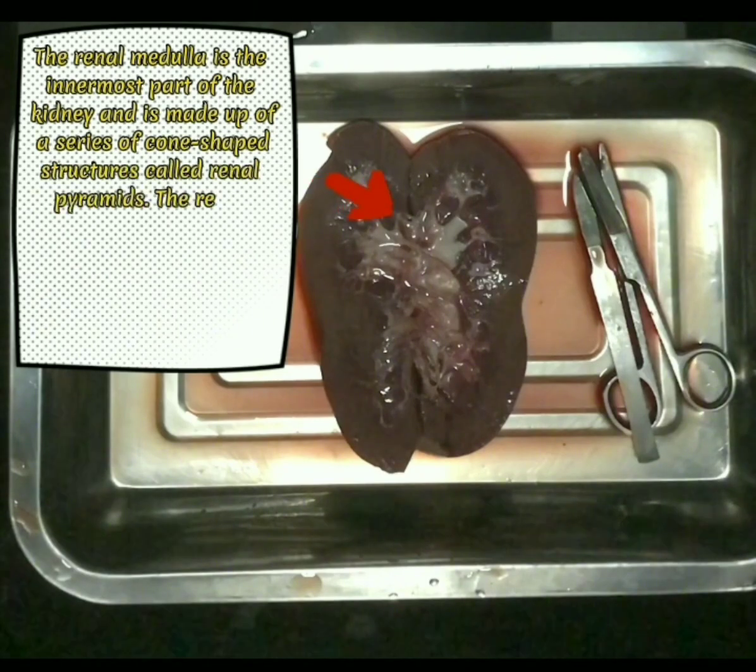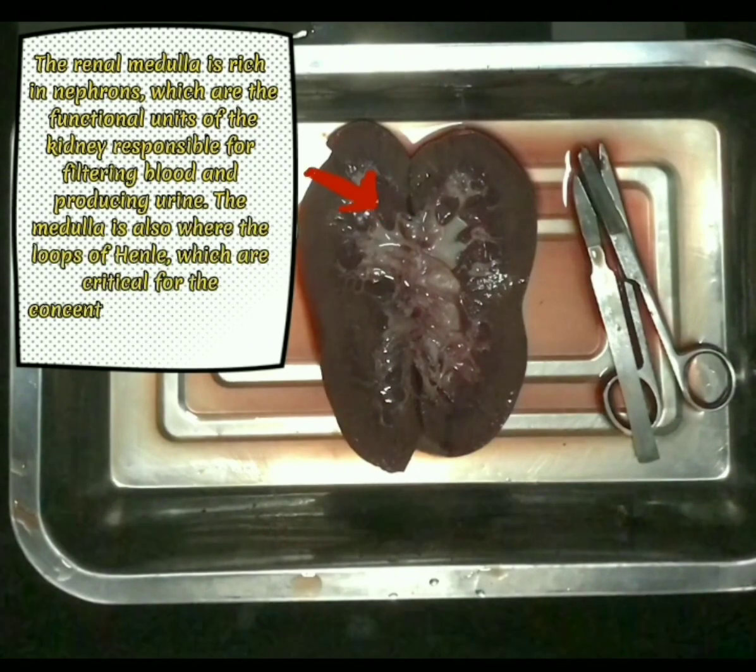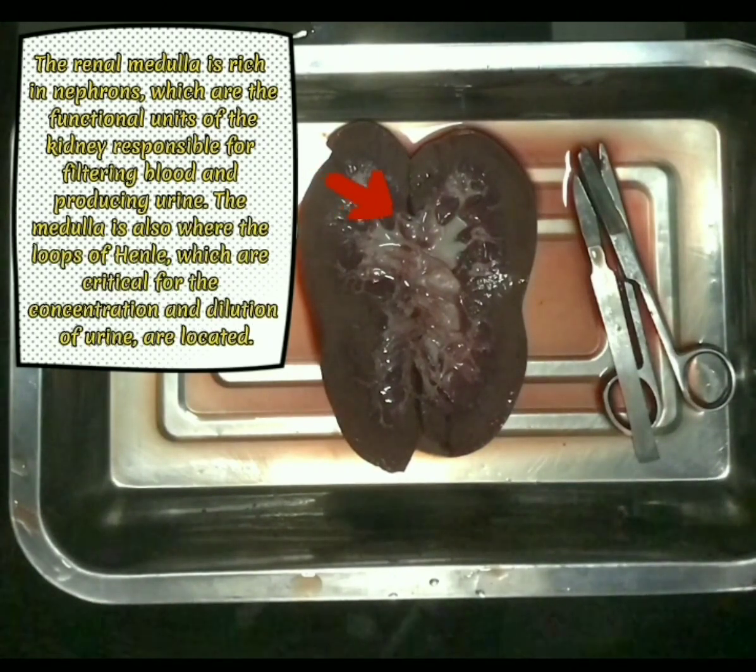This is now our renal medulla. The renal medulla is the innermost part of the kidney and is made up of a series of cone-shaped structures called renal pyramids. The renal medulla is usually darker in color compared to the renal cortex, which is the outer region of the kidney. The renal medulla is rich in nephrons, which are the functional units of the kidney responsible for filtering blood and producing urine.